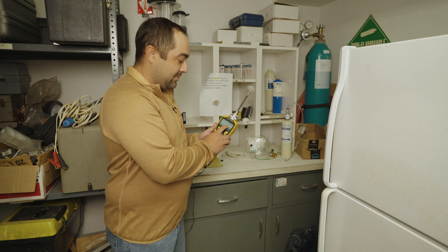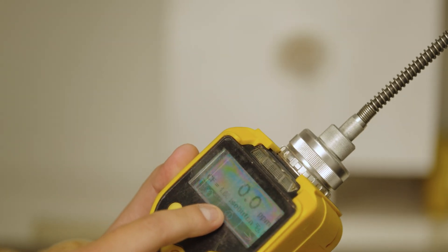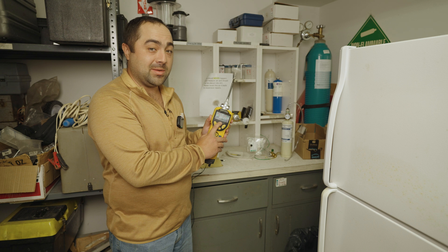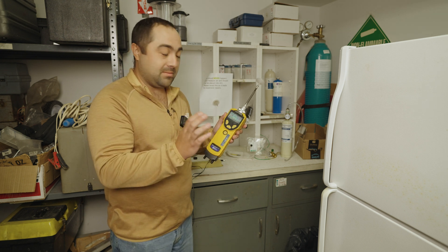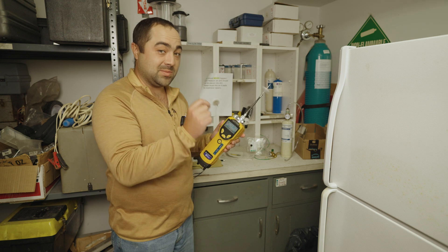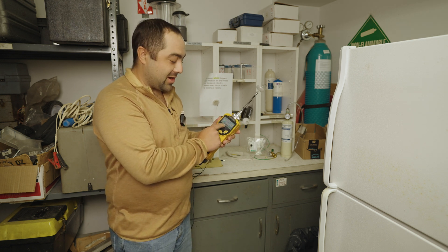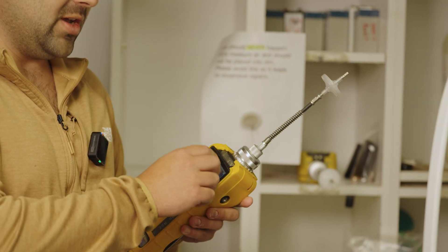The reading is in parts per million and right now we have it set to read for isobutylene as our correction factor. You can change your correction factor depending on what kinds of compounds you're going to be looking for. Isobutylene is a range of many different compounds, so it's usually pretty standard, but if you're looking specifically for diesel or fuel oil or you know what you're trying to search for, you can change the correction factor on here to isolate what you're trying to find for VOCs.